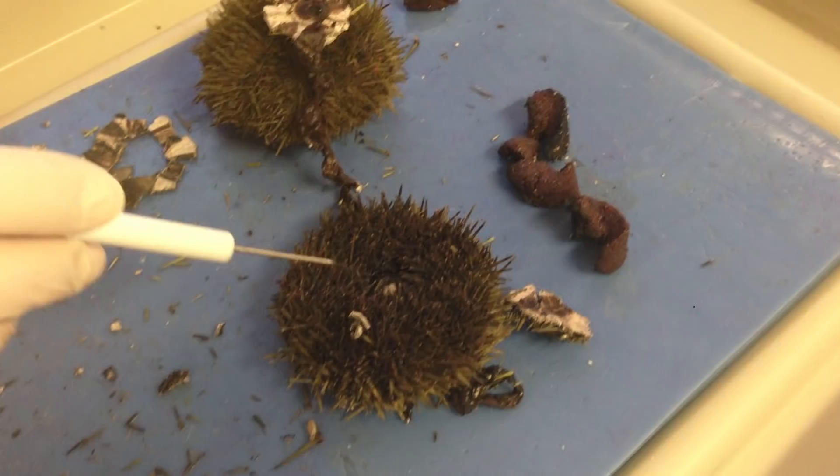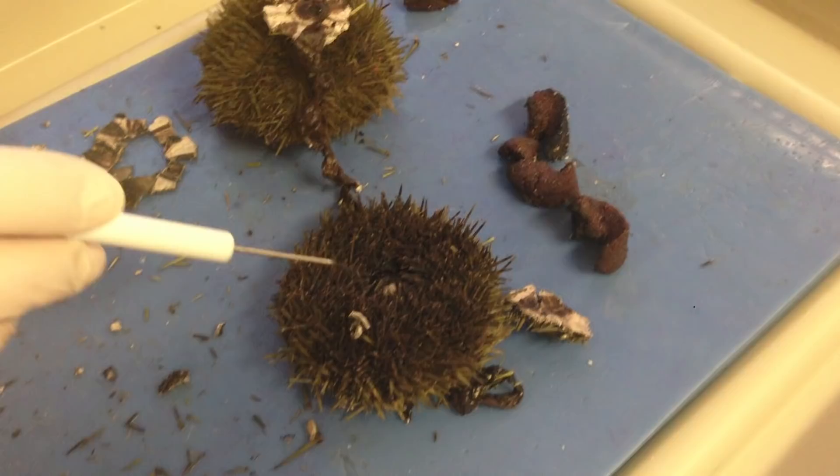Looking at this again, if we had this still intact, the stone canal would lead to — and this is the important thing that you guys notice — the little brown structure that goes around the top of Aristotle's lantern.